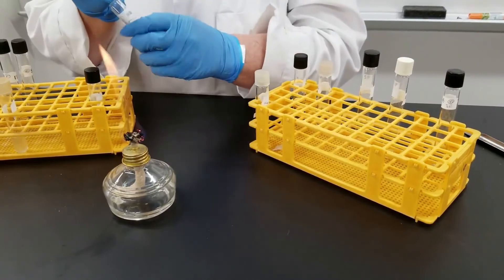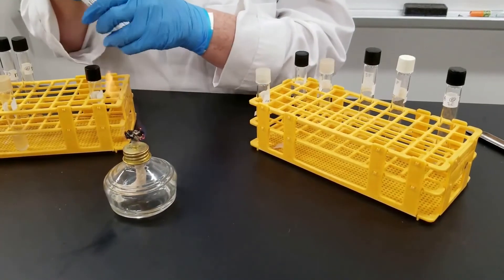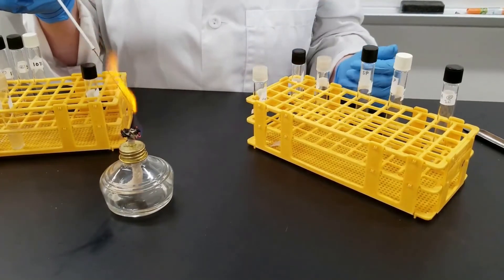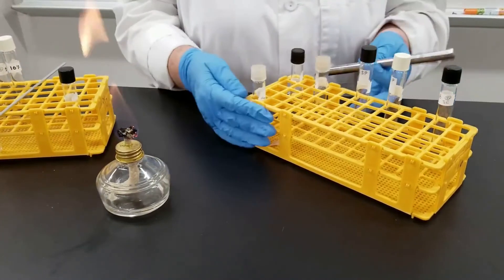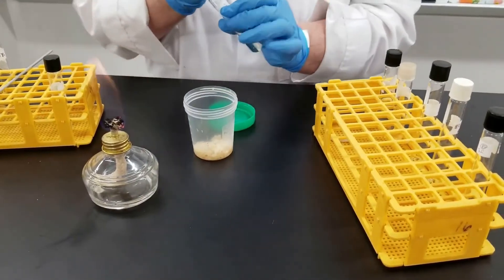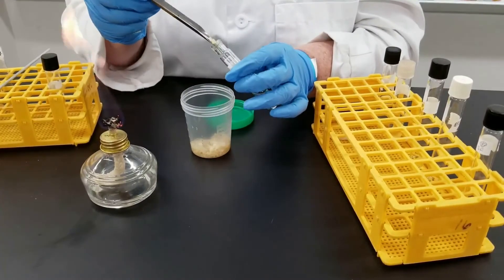This is the final salt concentration tube. I want to make sure that my needle or loop is nice and sterile at all times, and certainly I don't want to be transferring any salt into the tube with the garlic — from a research standpoint, that would be a problem if the salt were what's inhibiting growth rather than the garlic. This is sterile nutrient broth, and I'm just going to eyeball the amount of garlic and add some in.